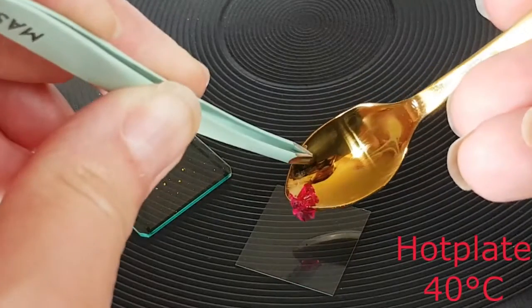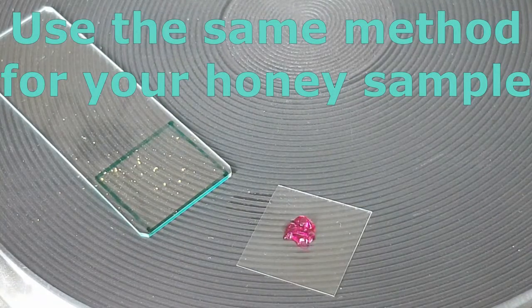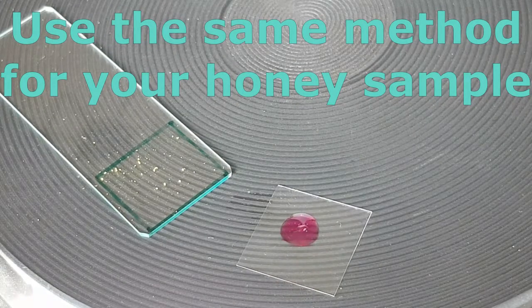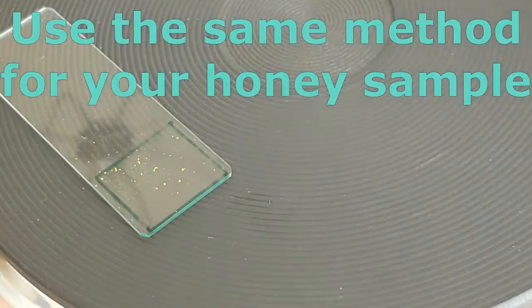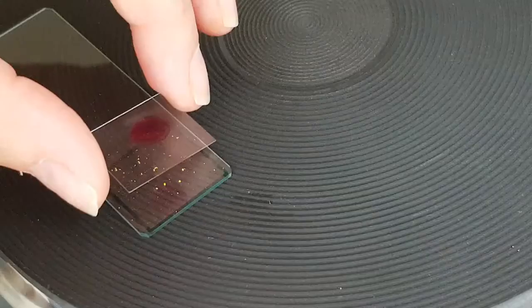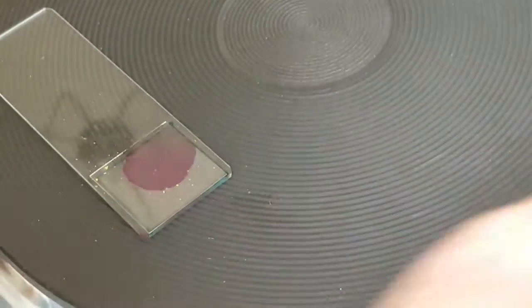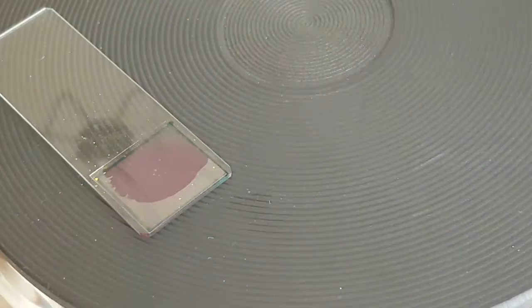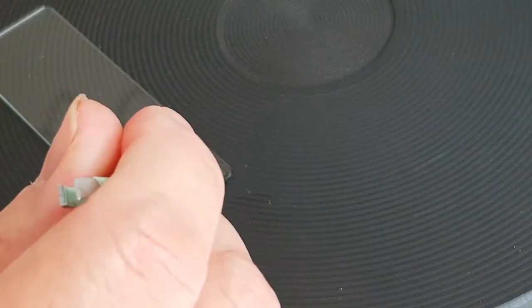Smallest amount of glycerin jelly in the middle of the slide. That will melt. You'll see that the next bit is really tricky. Don't want to put my fingers over the slide. I just want to pick it up on its edges and gently place it over the top of the slide to try and create a nice seal. It's incredibly delicate. Not bad, not bad. Now that can sit on the hot plate for about 10 minutes, and then we'll put it underneath the microscope.